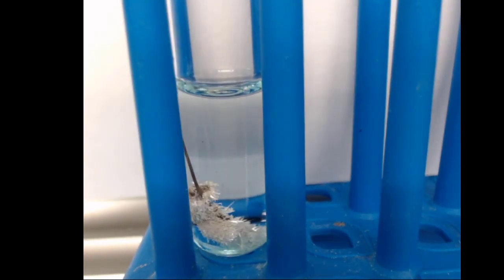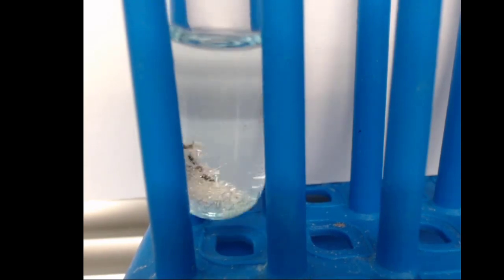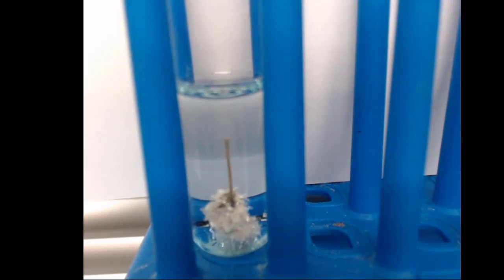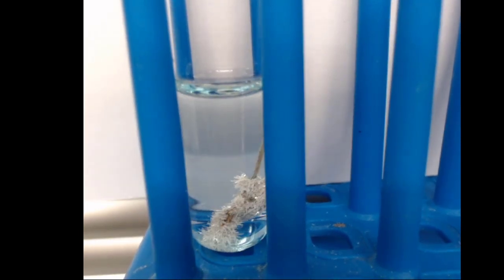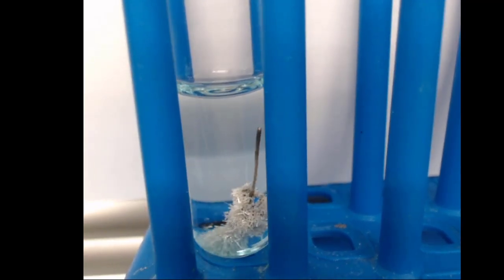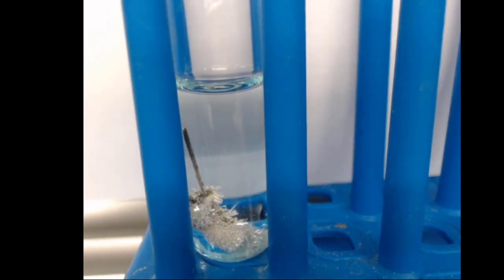If I give it a little shake, you can see the silver metal will fall away from the copper, and if I let this sit for another 10 minutes, that was 10 minutes by the way that just went by, we could form a little bit more silver metal, assuming that there's still silver left in the solution. So I think that one's pretty neat. It's slow. It's one of those things that probably looks better sped up, but that's a redox reaction.